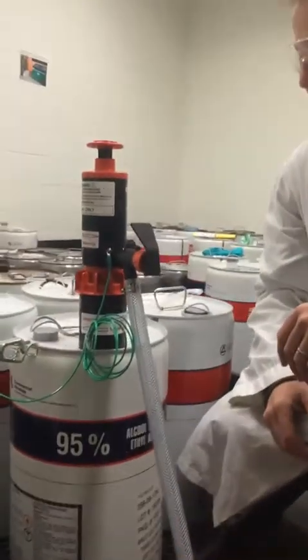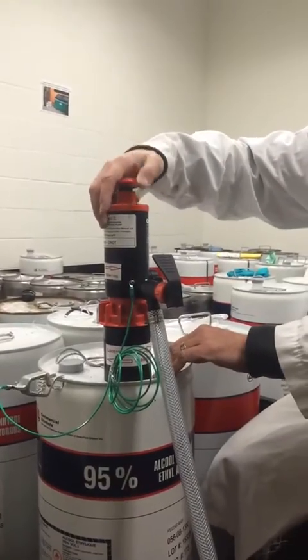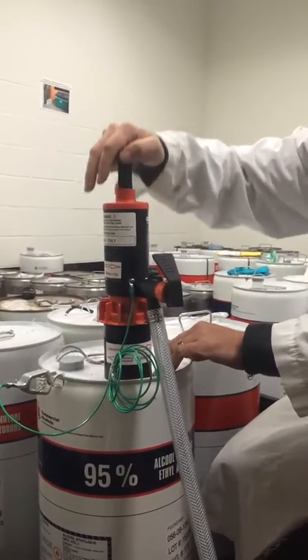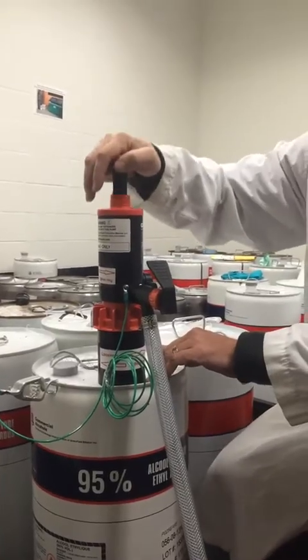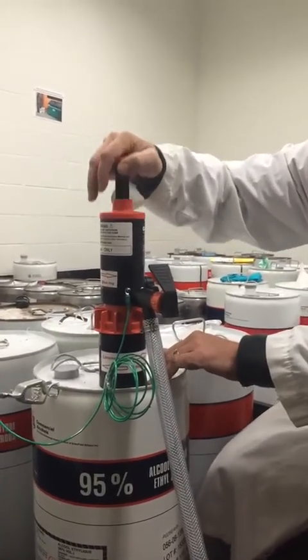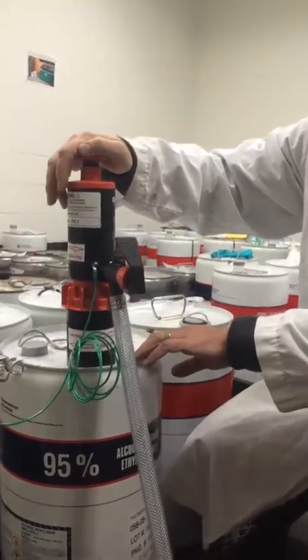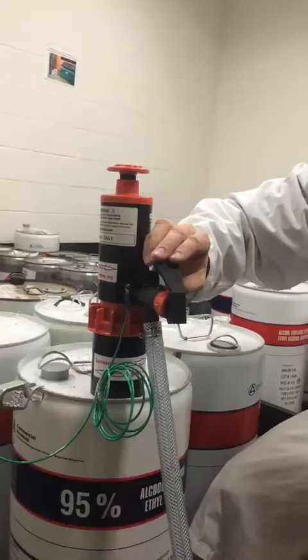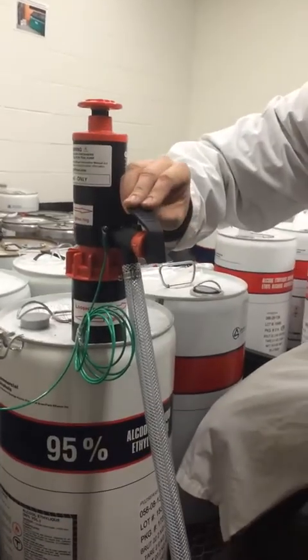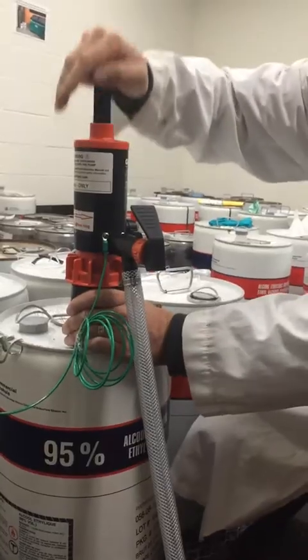At this point you're ready to go. Pump the lever a few times — one, two, three — and you'll hear and feel the pressure building inside the pump and the canister. Do that half a dozen times or so and you're ready to dispense. Make sure you're wearing your safety glasses and lab coat because it is a pressurized pump. Then push down on the lever to dispense.